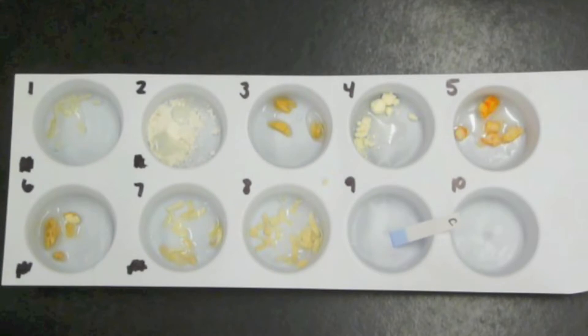Once again we will add a control strip here so that we can look back and see if the blue powder color has changed after we perform the experiment.